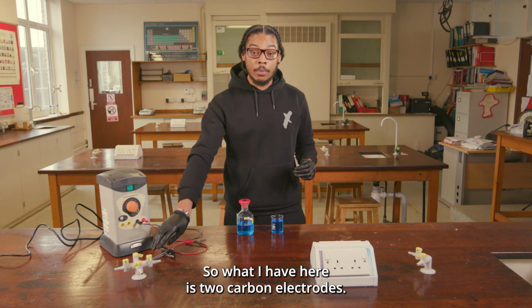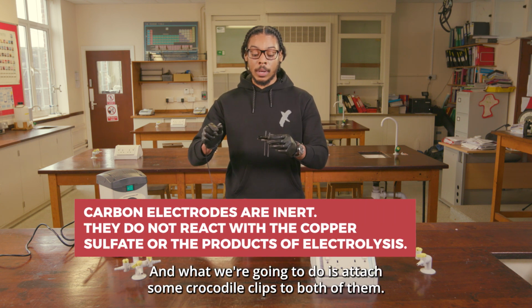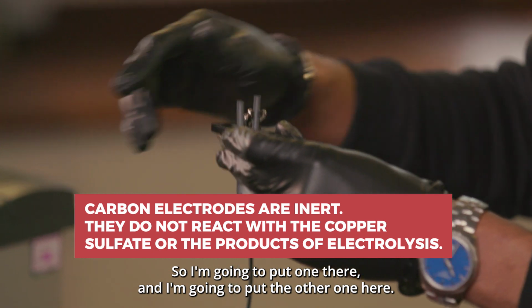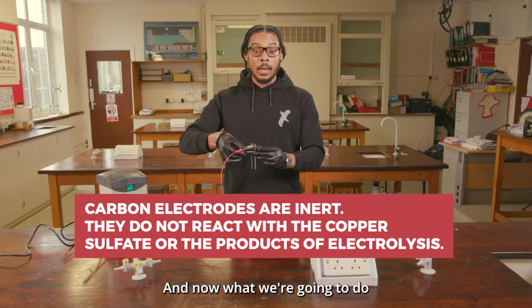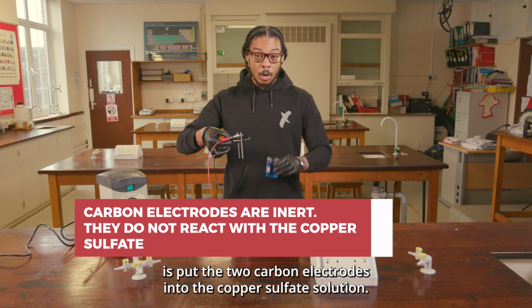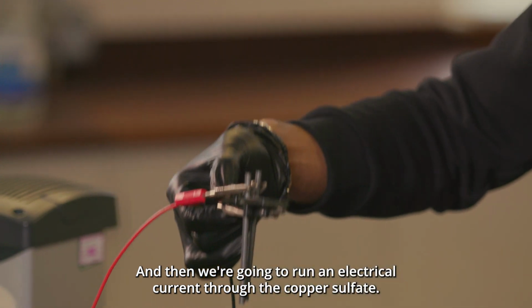Alright, cool. So what I have here is 2 carbon electrodes, and what we're going to do is attach some crocodile clips to both of them. So I'm going to put one there and I'm going to put the other one here. And now what we're going to do is put the 2 carbon electrodes into the copper sulfate solution, and then we're going to run an electrical current through the copper sulfate.